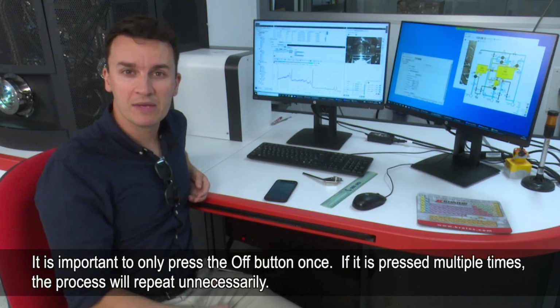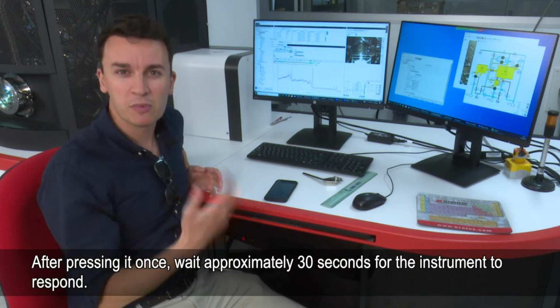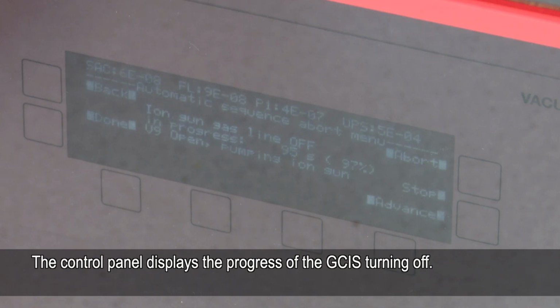If you press it a few times, it will do the off cycle, then it will do it again and again and again. So just once, then you have to wait about 30 seconds, and then the instrument engages, and then you can see it happening. This is the GCIS turning off.